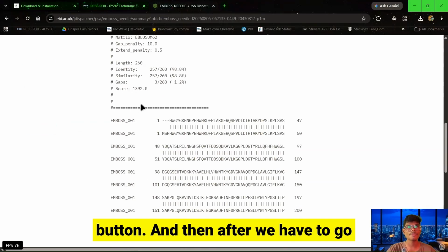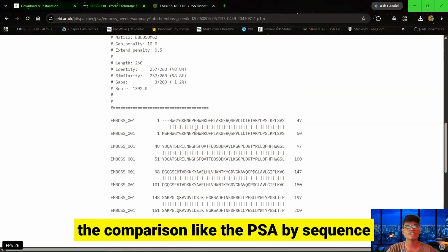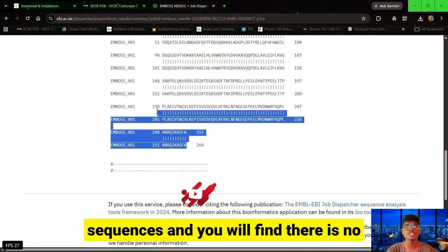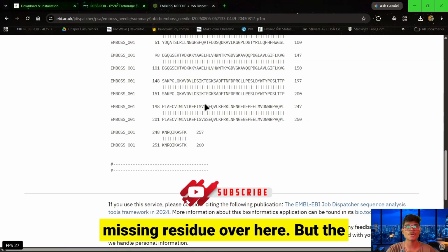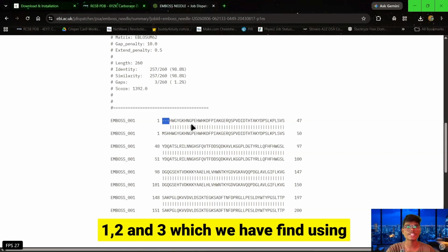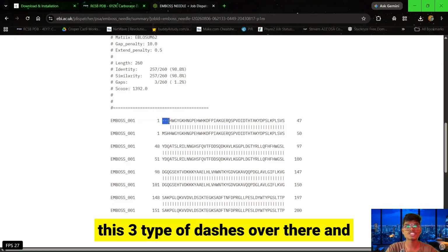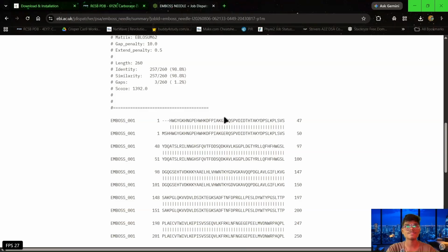And then we have to go to the sequence, and here you will find the comparison, like the PSA, pairwise sequence alignment, between those two sequences. You will find there is no missing residue over here, but the missing residues which are present are 1, 2, and 3, which we also found using WordPad. So we have to note these 3 dashes over there, and let's go for creation of the .ali file.